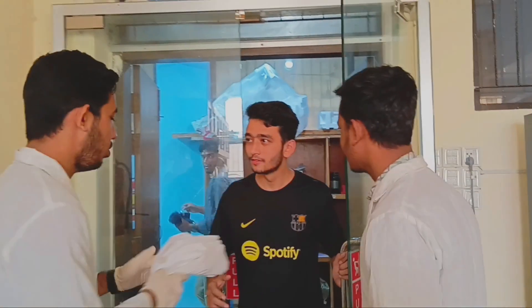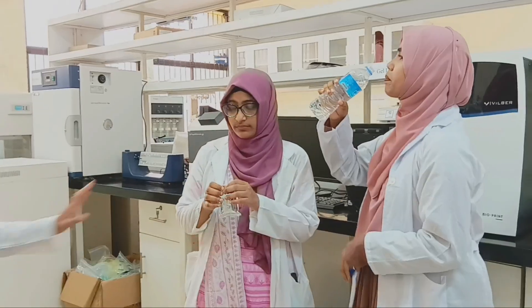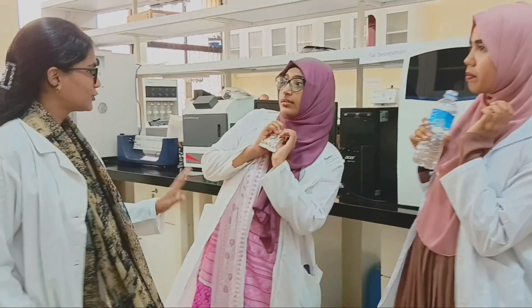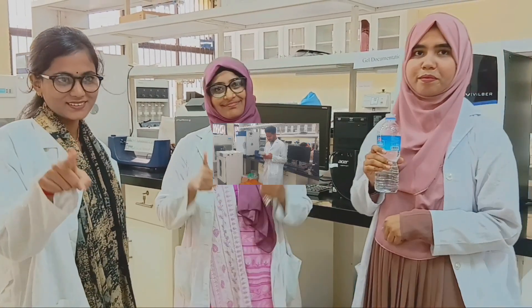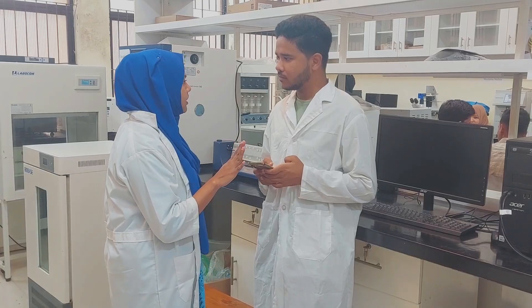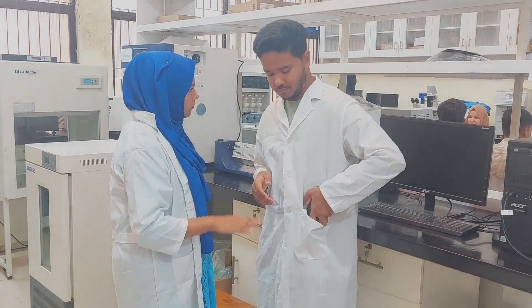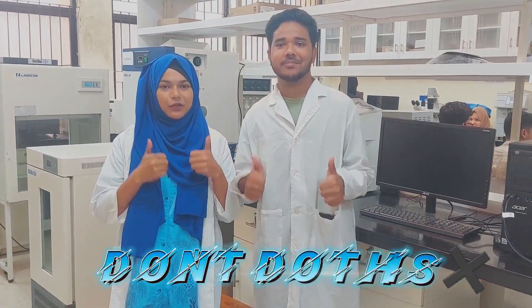Before starting, put on a lab coat and gloves. You should not use the extra devices carelessly in the lab, so please follow proper safety procedures.